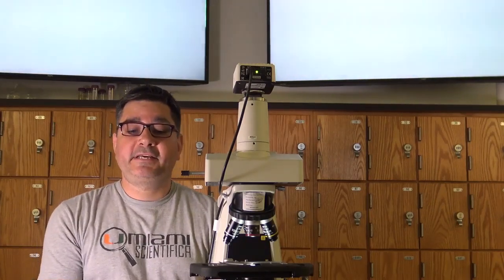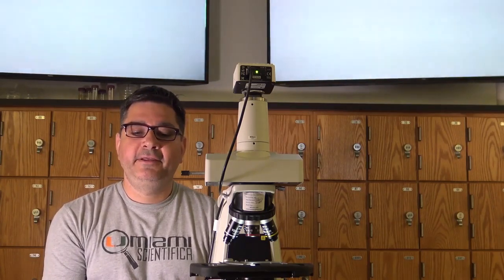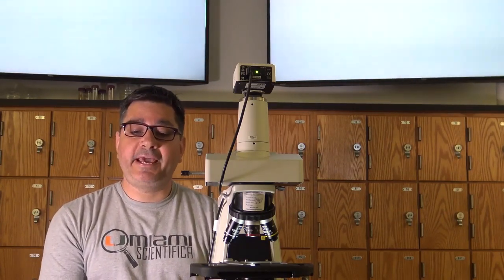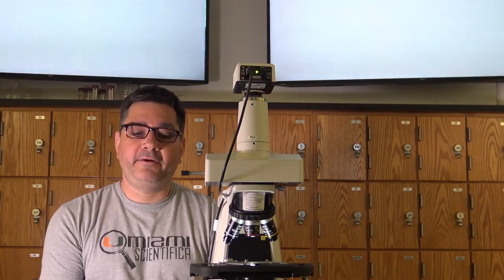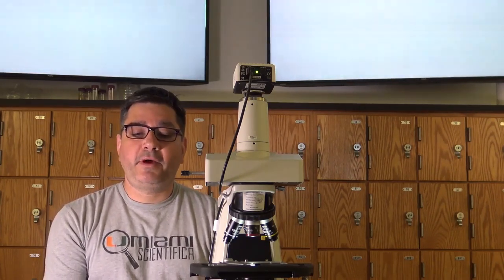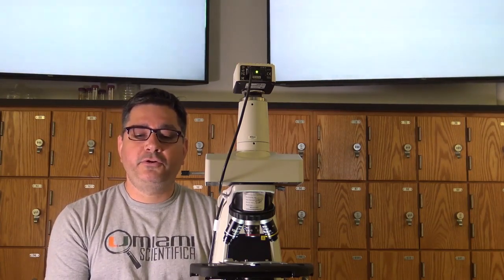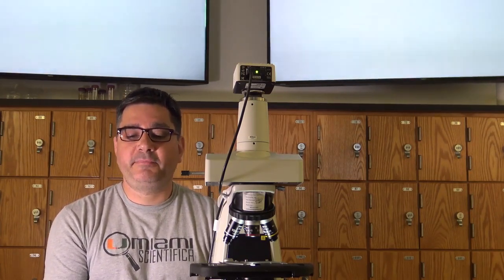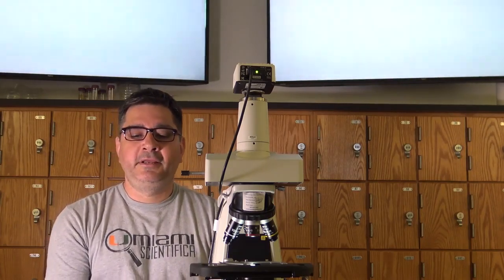Hello, today we'll be discussing a very important part of your life this semester in our laboratory. I'd like to introduce you now to the Nikon E200 Compound Light Clinical Microscope. The E200 will either be your best friend or worst enemy this semester. In order to facilitate a good relationship between the two of you, I have put together Microscope 101.